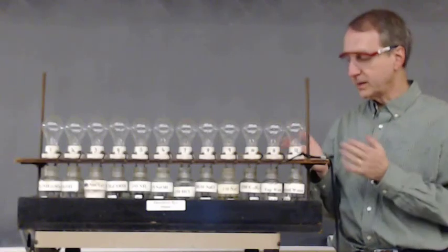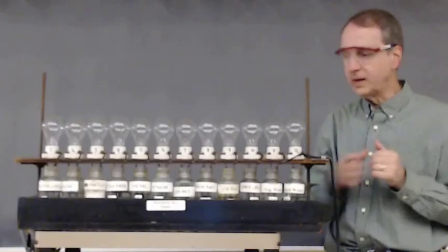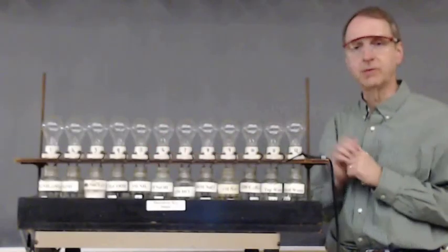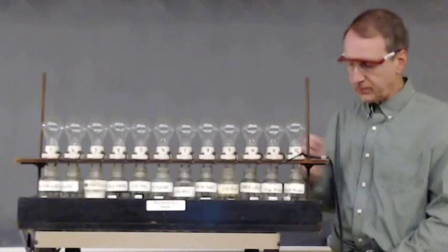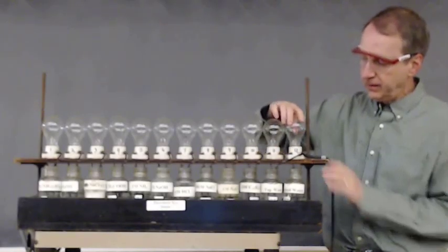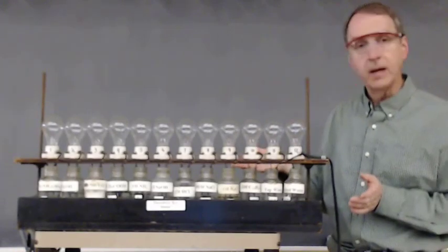So again, we've got our light bulb test, but now instead of one beaker with one light bulb, we've got 12 jars with 12 light bulbs, and we'll look at a lot of them. First of all, over here on the right, distilled water. We already know that that shouldn't light up, and in fact it doesn't.